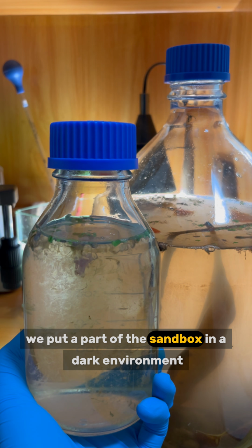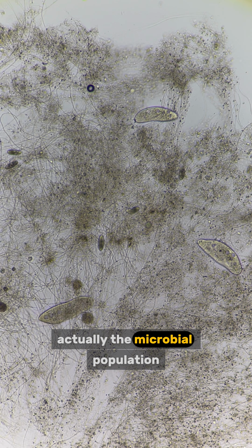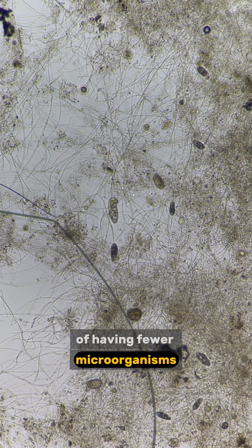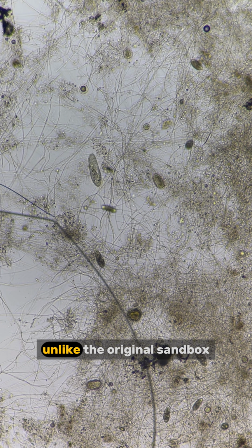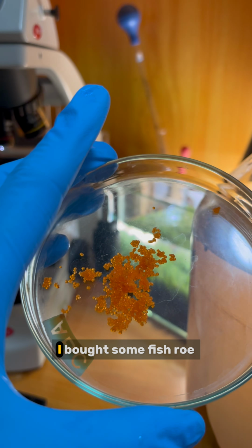Remember, we put a part of the sandbox in a dark environment a week ago. Let's take a look now. Actually, the microbial population is quite similar to the original one, with a slight difference of having fewer microorganisms, especially bacteria. I think it is because it is kept indoors, unlike the original sandbox, which is outdoors, hotter, and acts as a natural incubator.